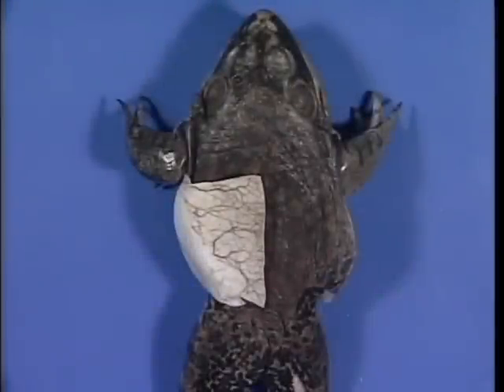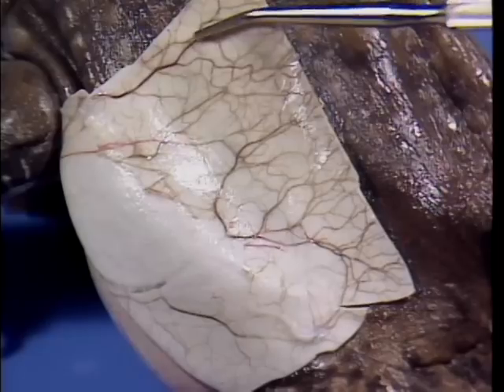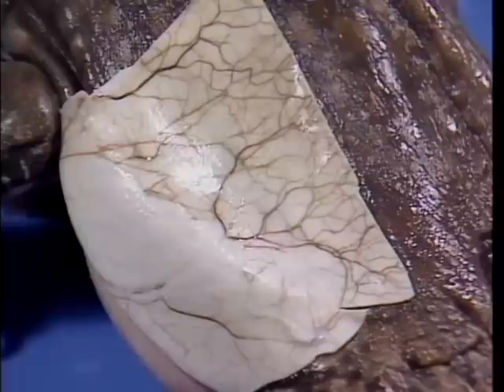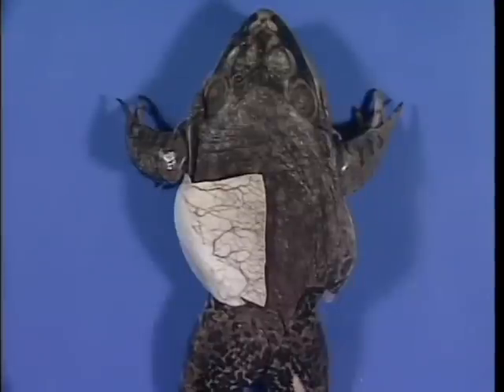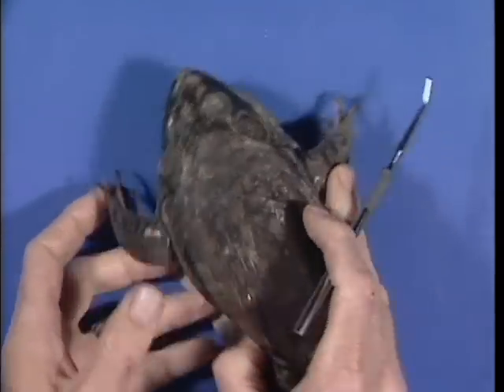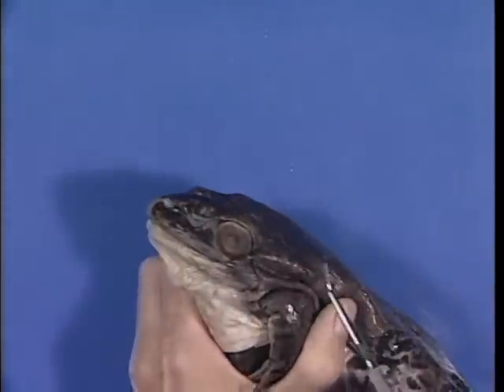Frogs obtain oxygen through the skin, as already discussed in Section 2. Most frogs also utilize paired lungs to obtain oxygen from the air, and some gas exchange takes place in the floor of the throat as well. The complete air path can be easily traced.